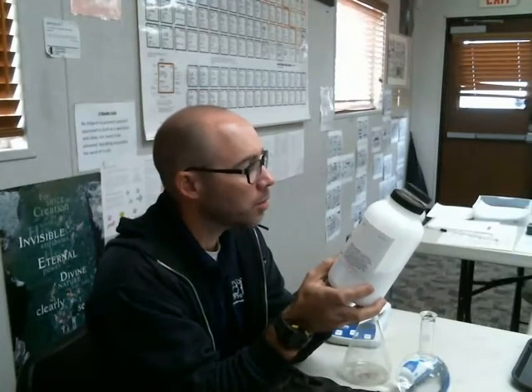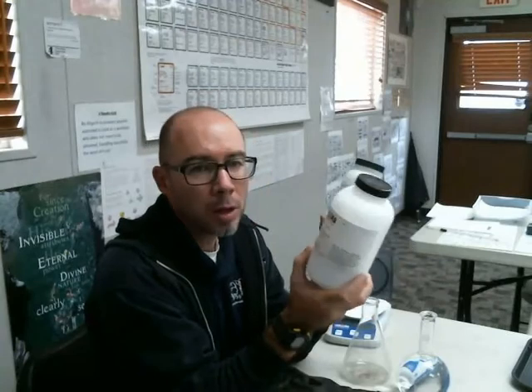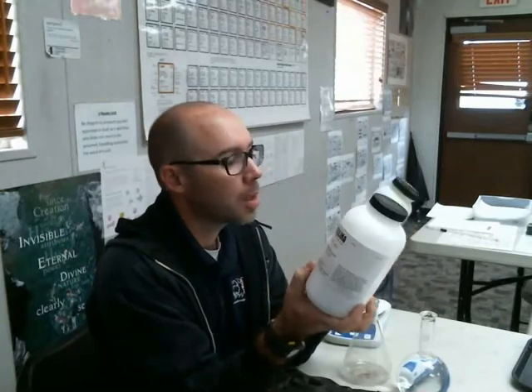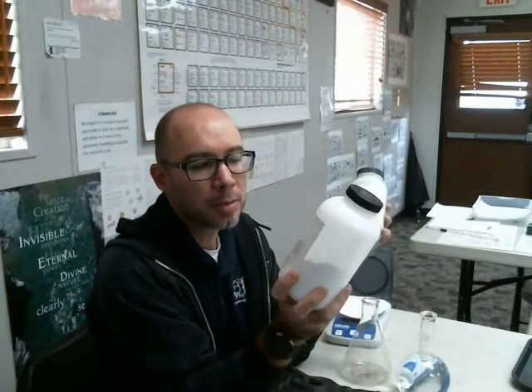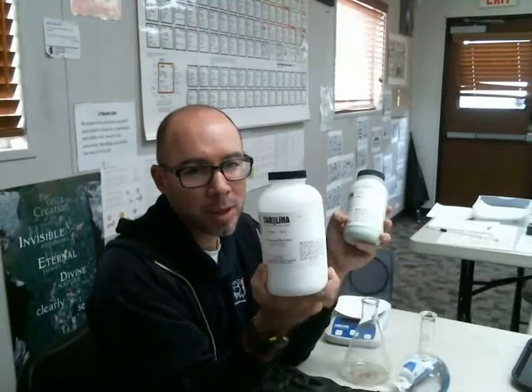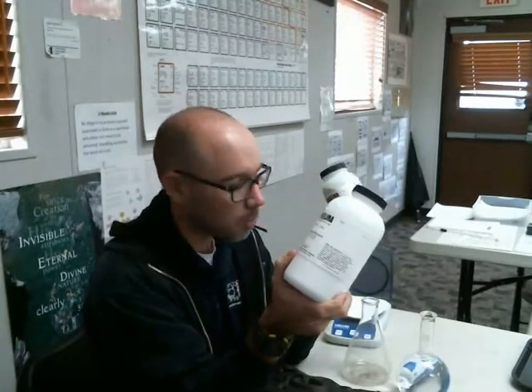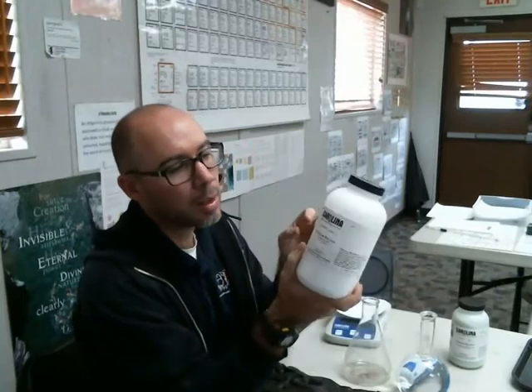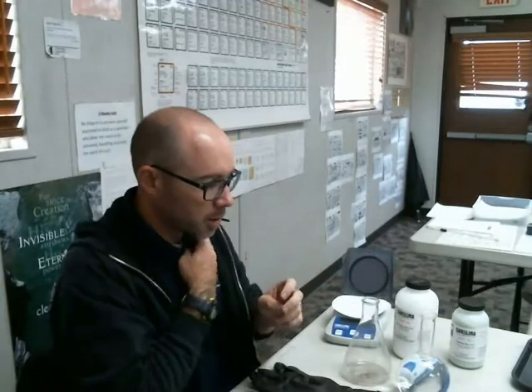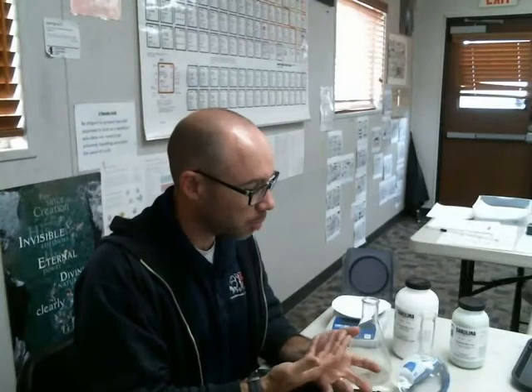I've got ferrous sulfate, FeSO4, but it comes with 7 waters, like our copper sulfate problem. And I've got potassium sulfate, and it's just all by itself, K2SO4. And doing the math, I would need to use a lot less of this than this one. So I'm going to go ahead with the K2SO4. Step 1 of this is to figure out the molar mass of K2SO4, because I want to know how much I should add to my solution.